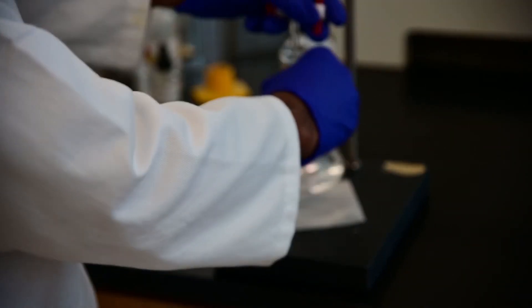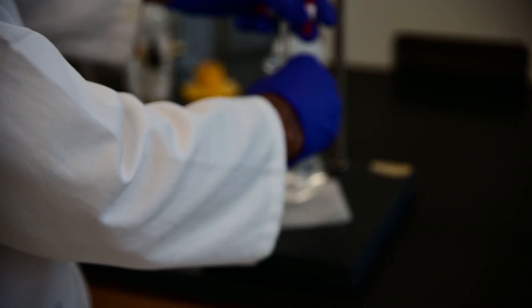You want to have a good control of how fast the drops are being added. Initially, you can add fast. Right now, as we can see, we are adding sodium hydroxide drop wise and we are also shaking the solution constantly.